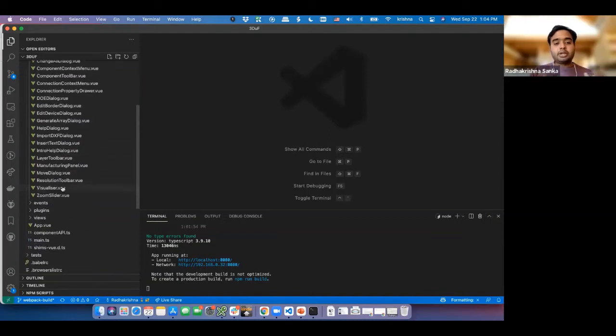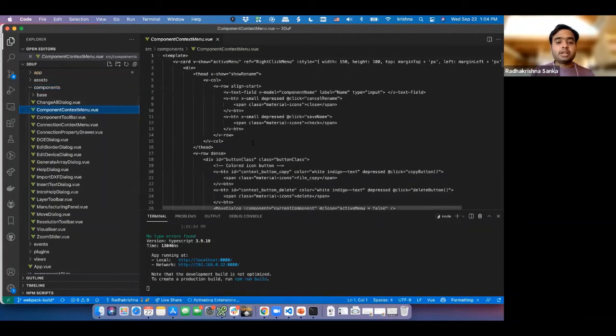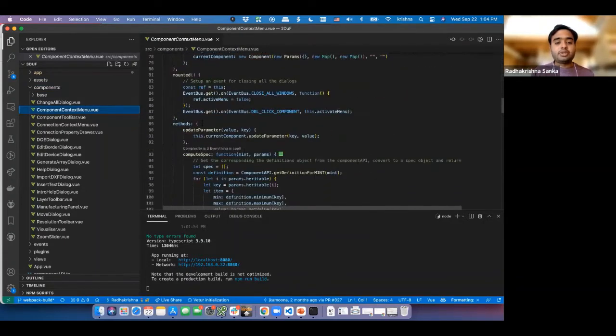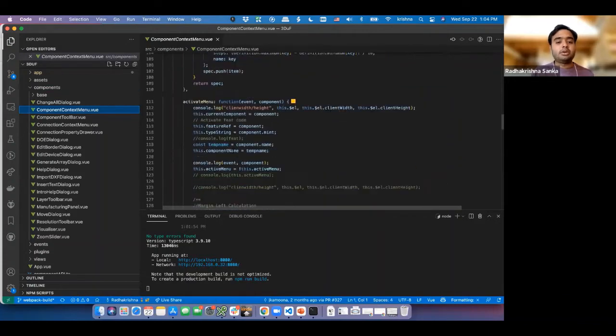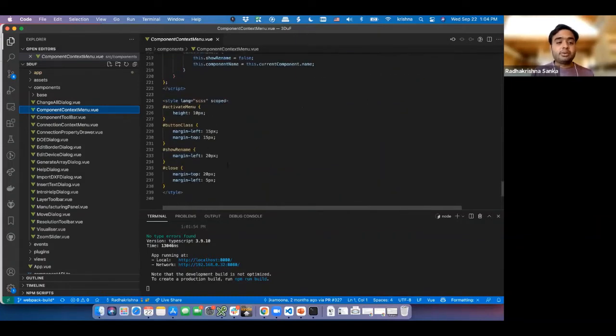Every UI element you see on every user interface is inside one of these Vue files. For example, it'll have all the HTML template code over here. It'll have what happens when you click on something, when you update a parameter, how to change everything, or when you activate or deactivate menus. It's all written over here. And similarly, it'll also have any specific styles associated with them over here. This way, if you're adding a new component, you don't necessarily need to know how the whole design system is built, but you just need to add your own individual component file, a Vue file over here, and you can extend the code and extend the UI.